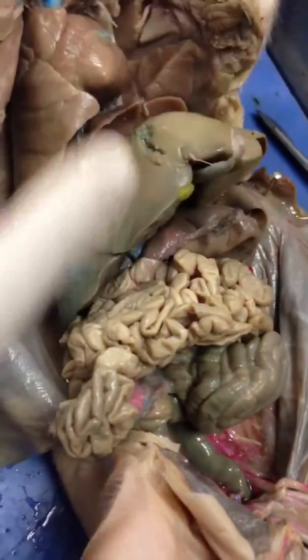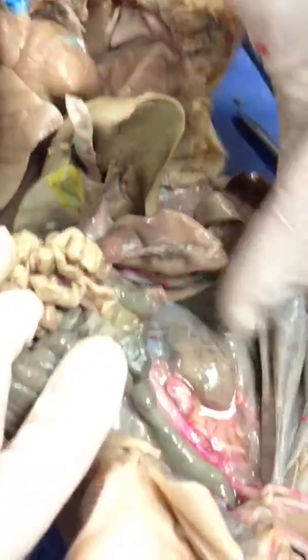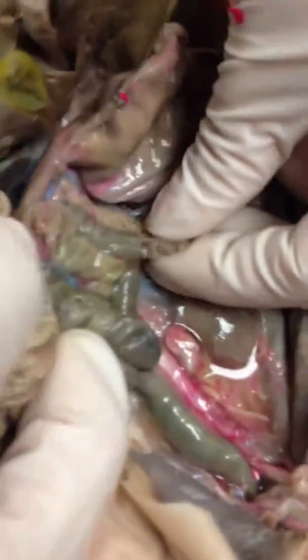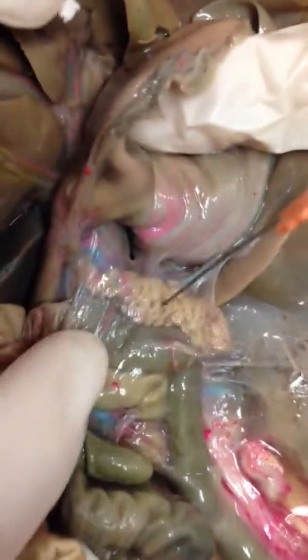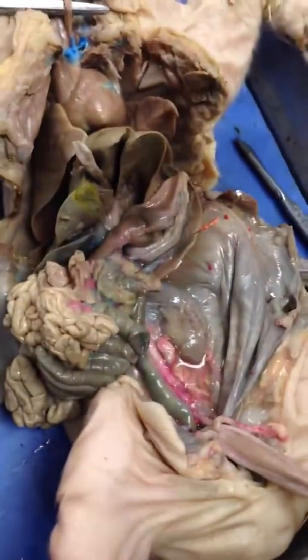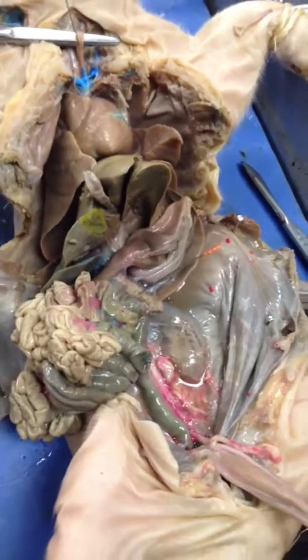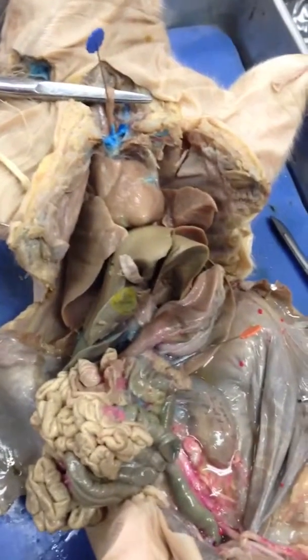Okay, and then besides the liver and the gallbladder for accessory digestive organs, we also have to identify the pancreas. The pancreas looks like a chewed up piece of gum, and it's going to be really posterior. So it's behind, right there. And we put a pin on it. That's the pancreas, right there. Alright, so those are all the structures that you have to identify, but then you can also look further and see all of the other systems that we've been through before.